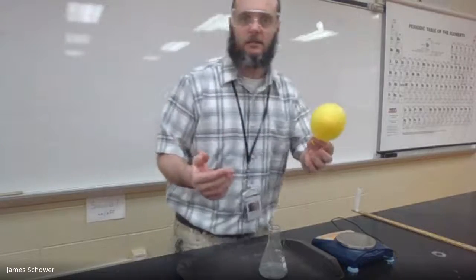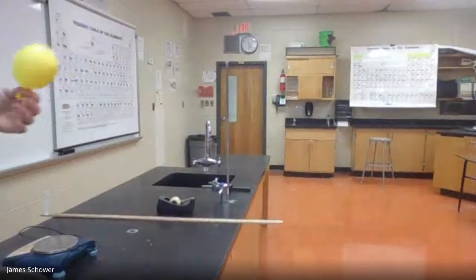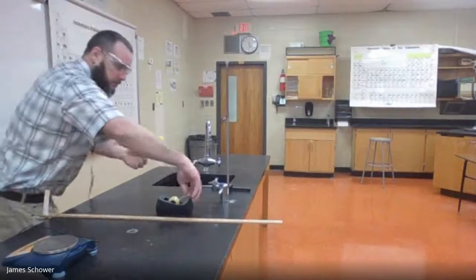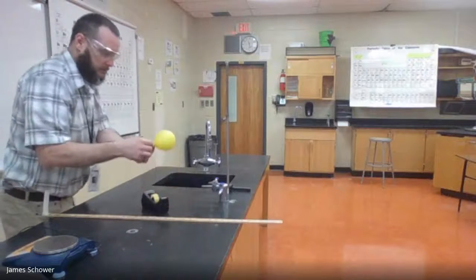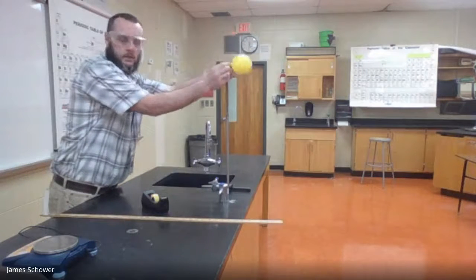So what I'm going to do is I'm going to turn the camera this way, take the balloon, tape it on to the ring stand.